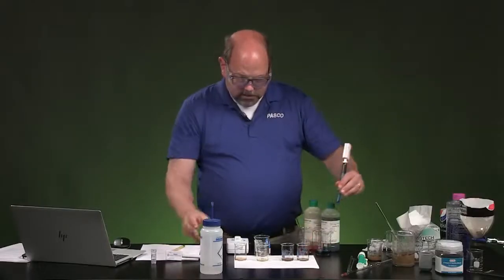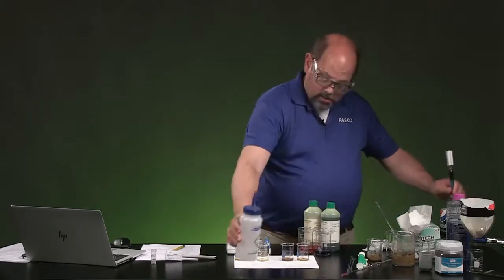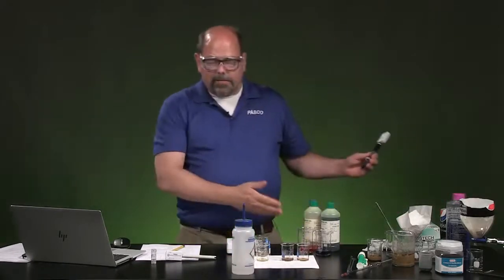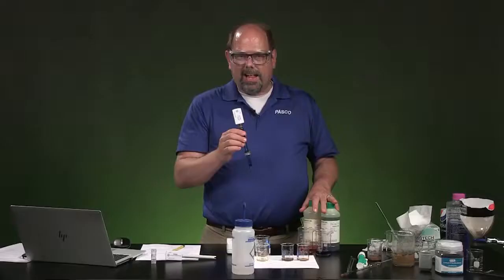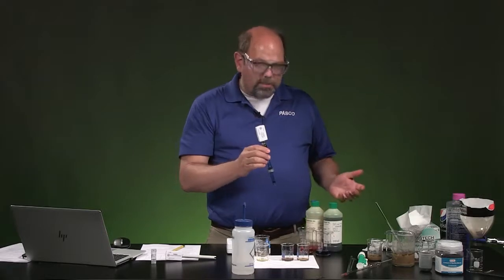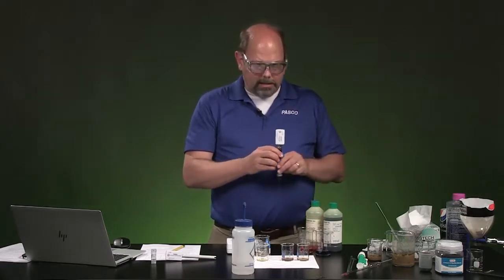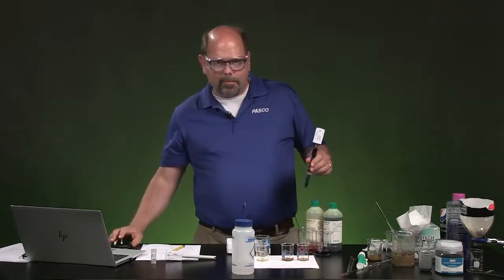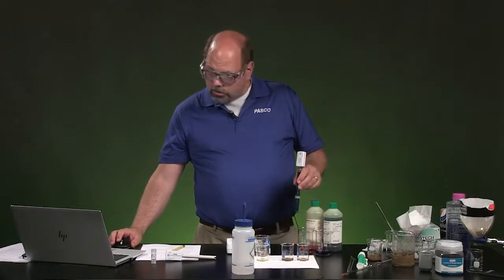All right, excellent. That's the pH sensor. Now, oh, and I've got the calibration that's right here. I did calibrate it right before we took the film. So let me show you that calibration process just so that you can see it. It didn't goof up my results, but I had performed it right before filming. Let's put these into the two calibration solutions.